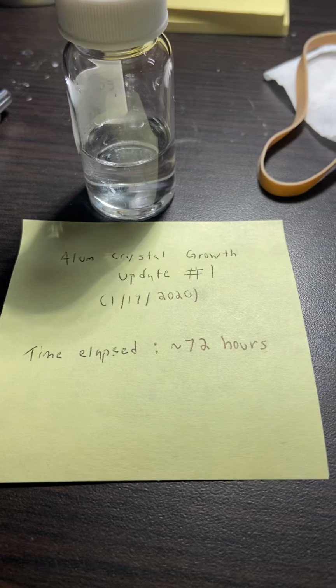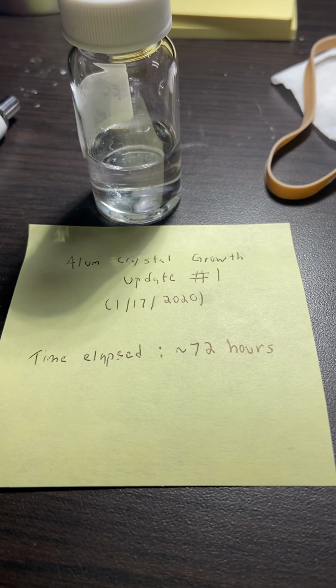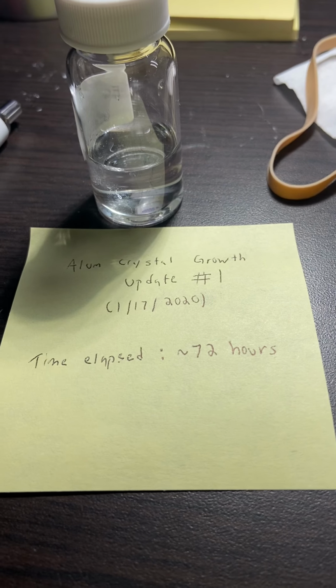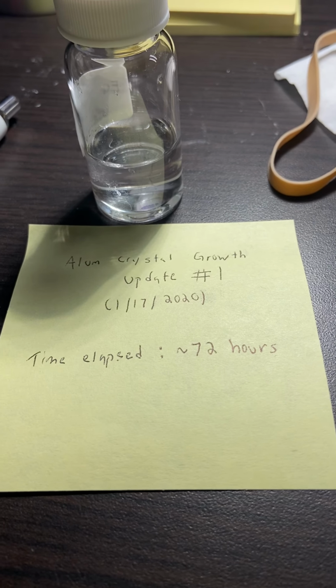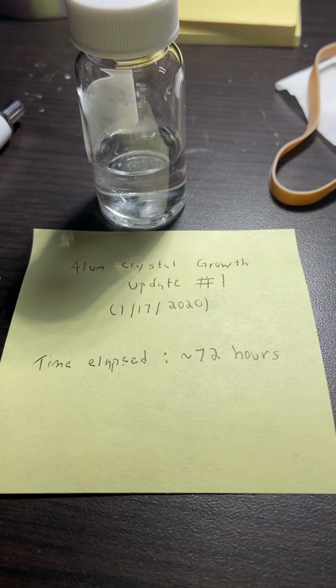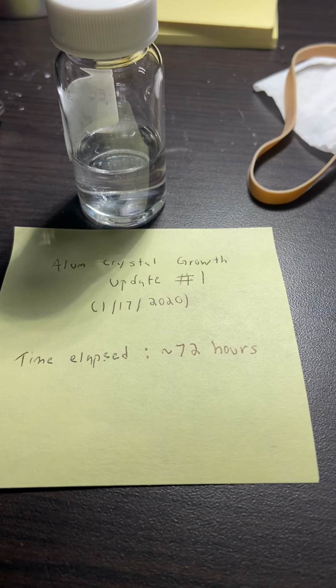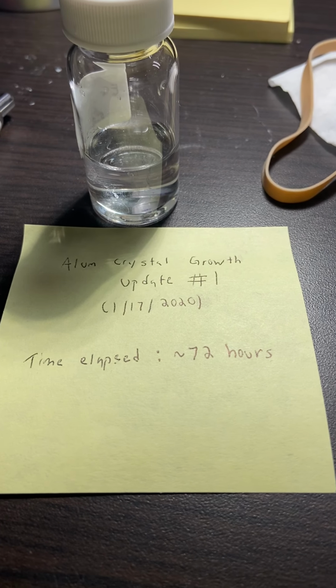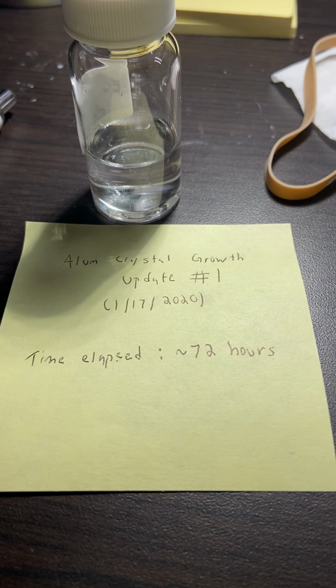to continue cleaning up. I'll have to take this into account as an accidental error and mistake, which may obviously delay and hopefully not, but probably corrupt the growth of my crystal over the next 2 weeks. I'm hoping that nucleation will still be able to occur properly and allow for crystals to solidify. However, regardless of this, I will be able to compare my crystal product to my lab partners.